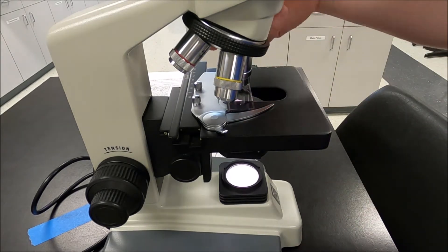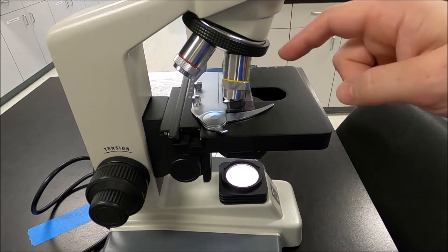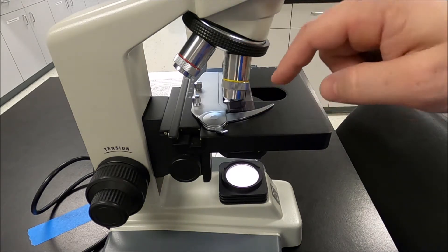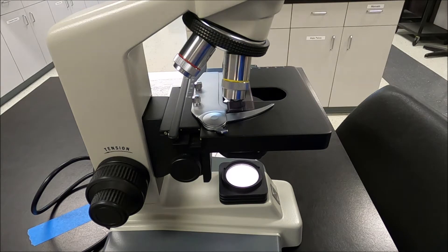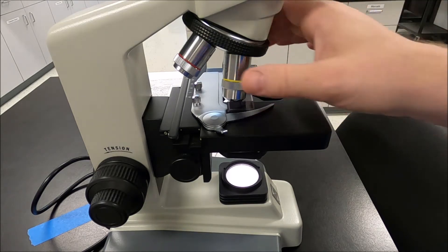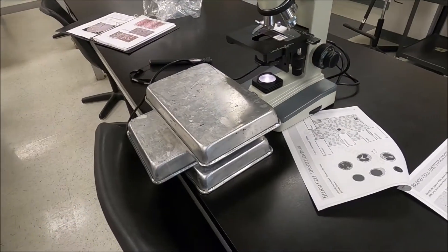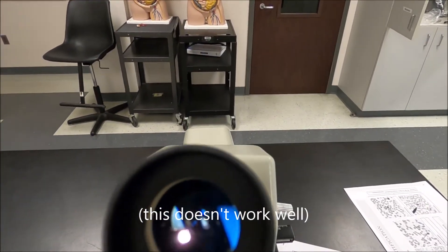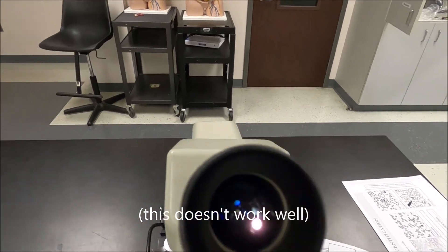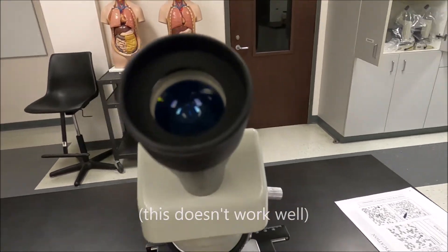Ideally we would have an oil immersion lens on here and we'd do oil immersion to really be able to see these nicely, but I'm going to do my best to keep it on standard light microscopy. Let's see if we can get this thing organized.